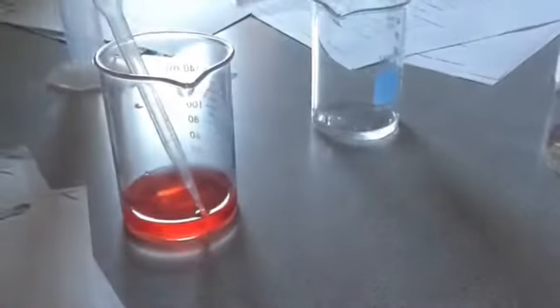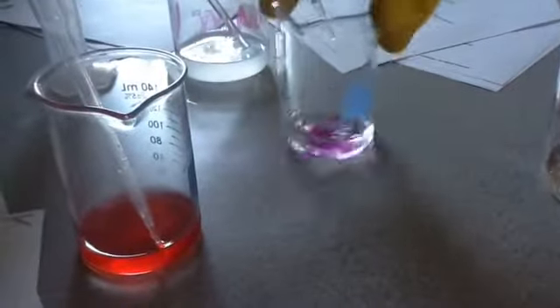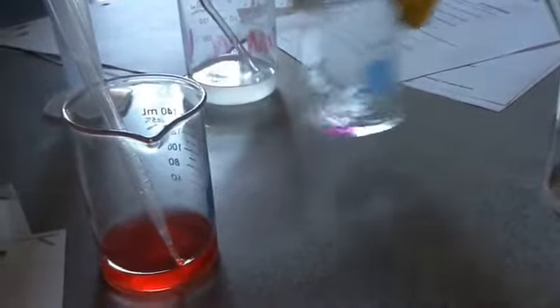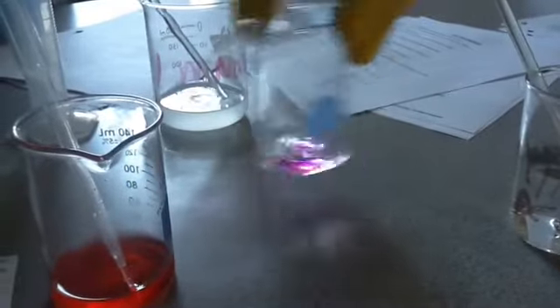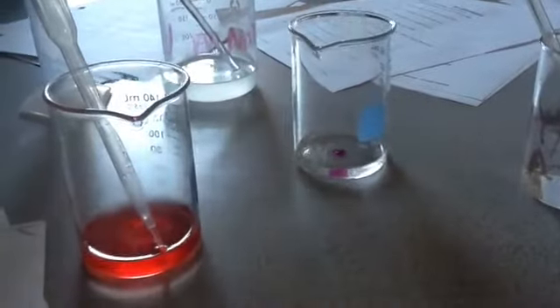When I add my base to the acid, you notice right now it's clear? It's the same experiment yesterday, right? As I add more and more base to it, it neutralizes it. Citric acid and vinegar, if it's the same molarity, it's actually the exact same calculations. You just figure out the amount of volume until it stays pinkish purple.